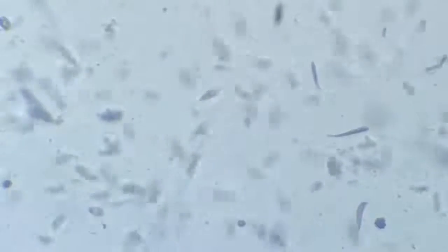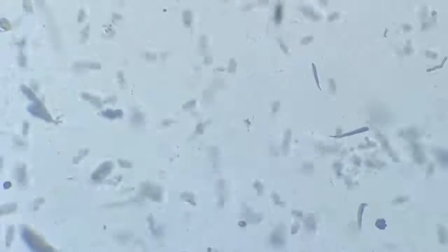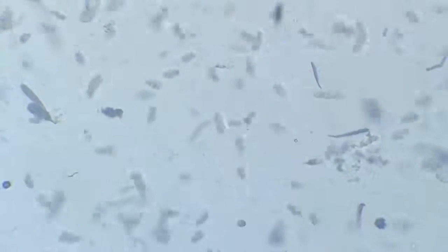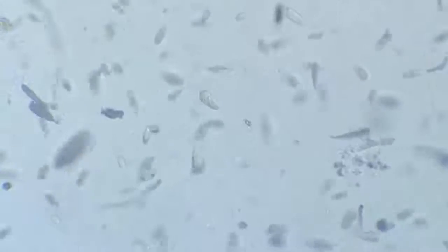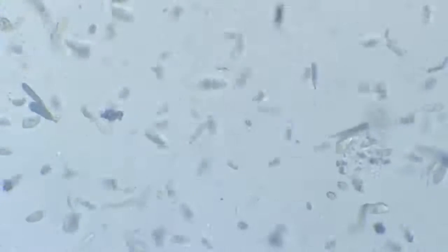These little feathery leaf-like structures are the ornaments on the mosquito's wings. They give it a kind of noiseless flight, or rather, these are the reason for the sound when it's flying, the zoom kind of sound that we hear.